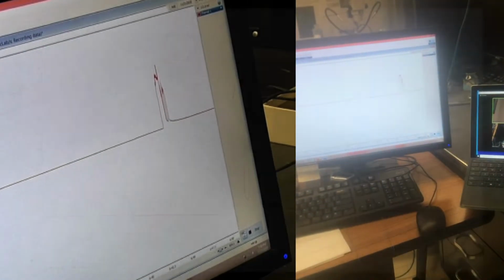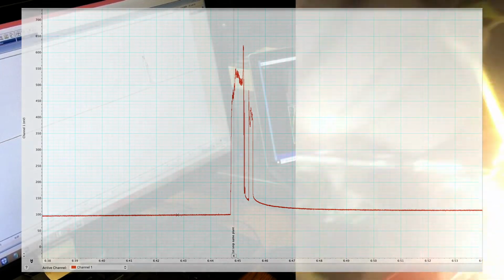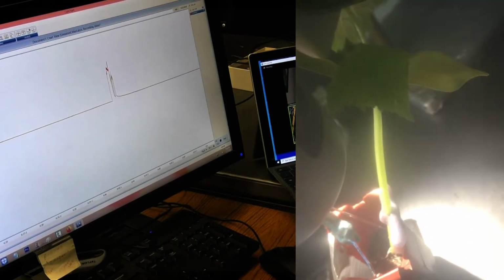There's the, oh, you can't see it. I can see it. Alright, and let me get the top so we can see how much we cut. There's how much we cut. And that was just about half of the scissor width.